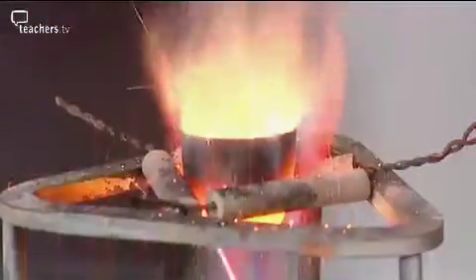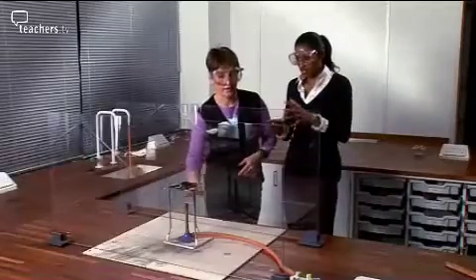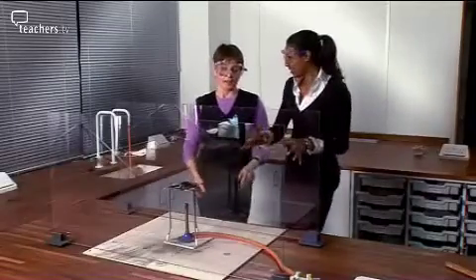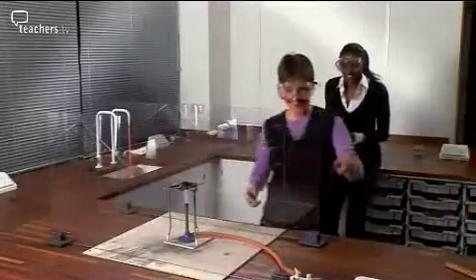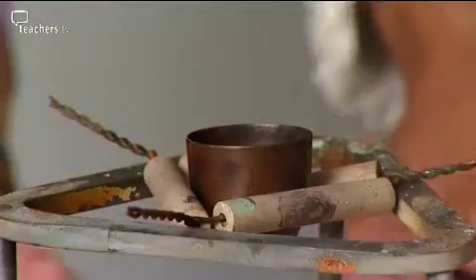I thought it hadn't gone off, and I went, as you did, to maybe pull the Bunsen out or something, and it actually went off just as I put my hand in. That could be so dangerous. Yeah. That's why you need to... But also how tempting it is to go and check on it. It's like a firework, isn't it? Yeah. You just don't go back to it. If you don't get a reaction, turn off the heat and wait for everything to cool.